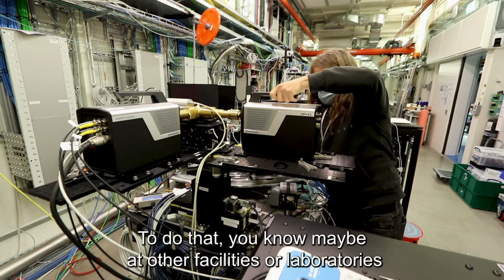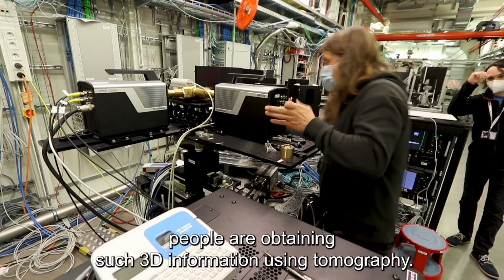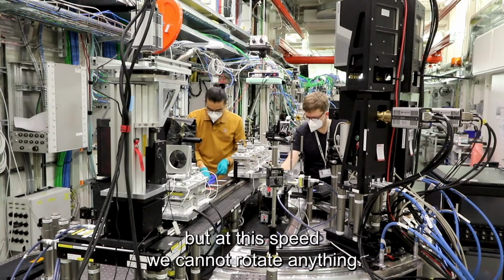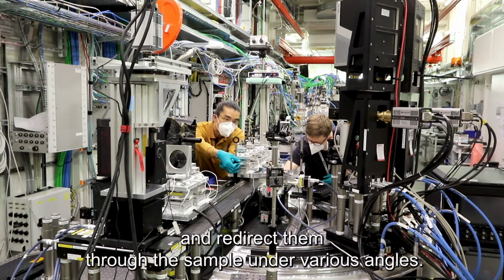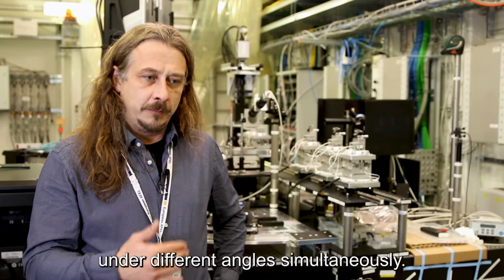And to do that, in other facilities or laboratories, people are obtaining such 3D information using tomography. So this is a rotating sample around some axis and you record images, but at these speeds we cannot rotate anything. The sample has to be stable. But what we can do, thanks to this brilliant source, is generate several probes and redirect them through the sample under various angles. So this will give us, for a single pulse exposure, different angles simultaneously.